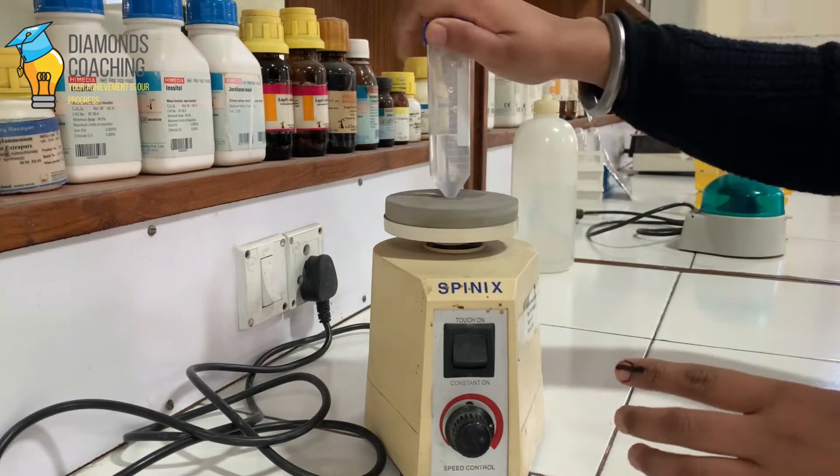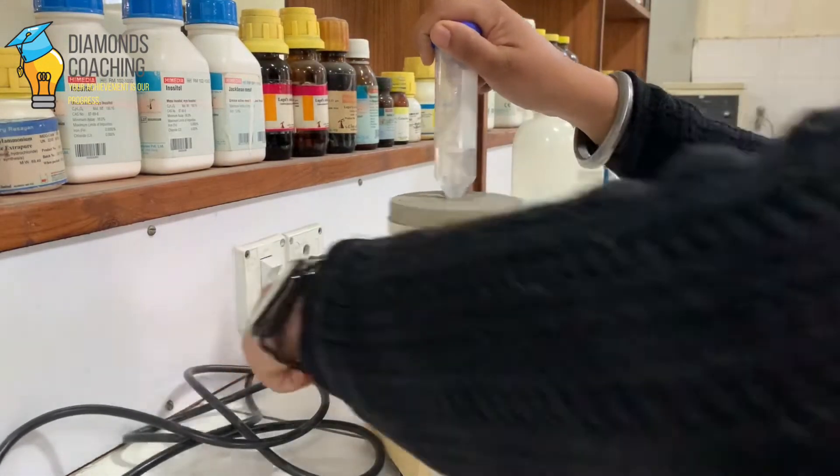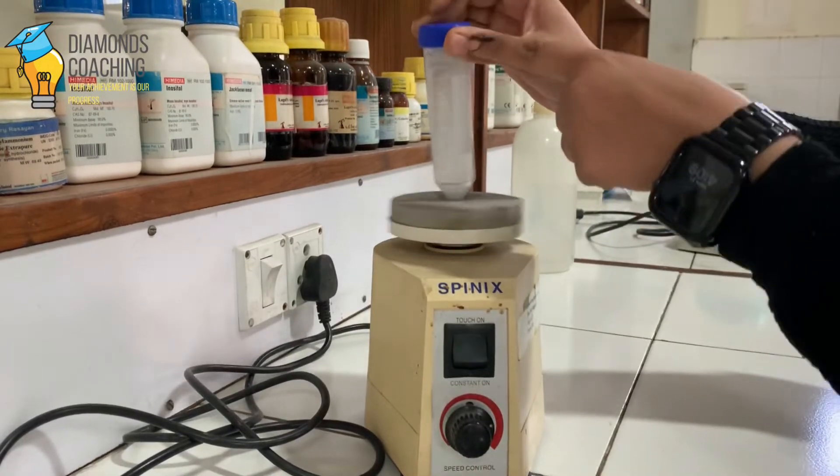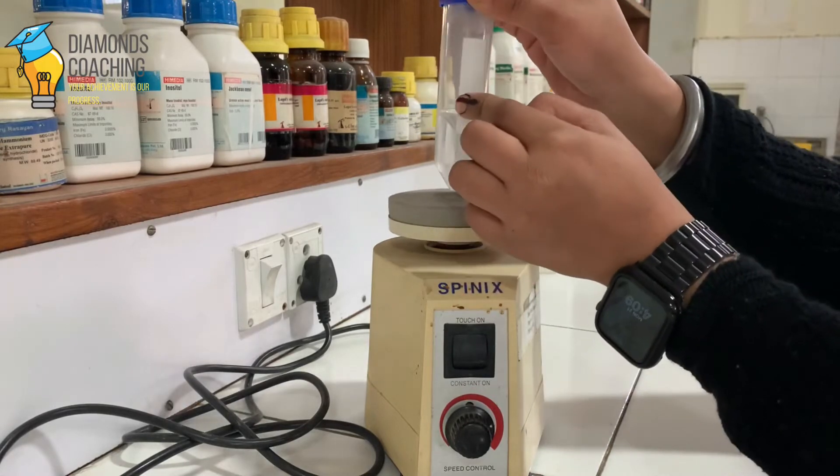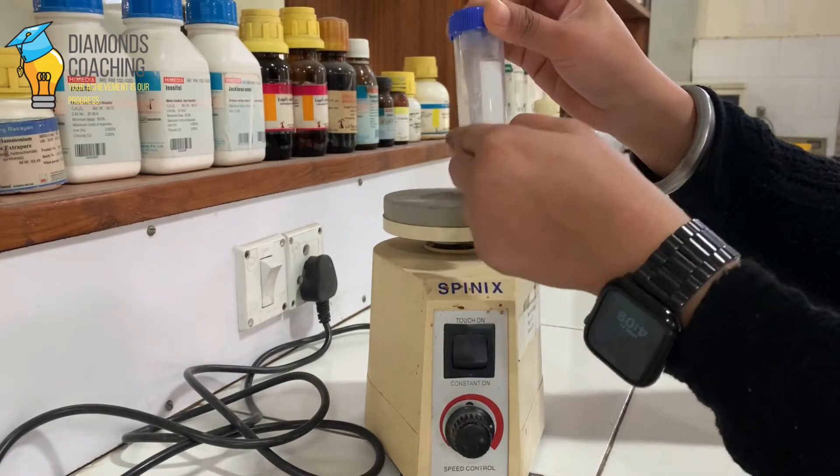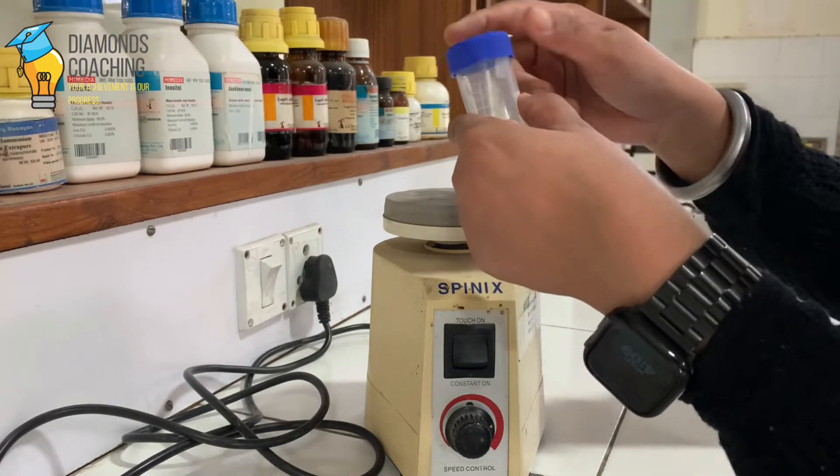And if we start this on, so let's see... yeah, and I'm holding this from upper side. What happens is the contents of the vial go upside and touch the cap of the vial.